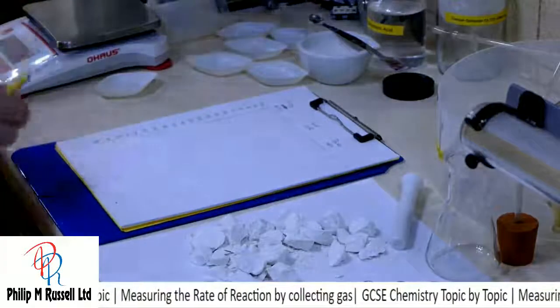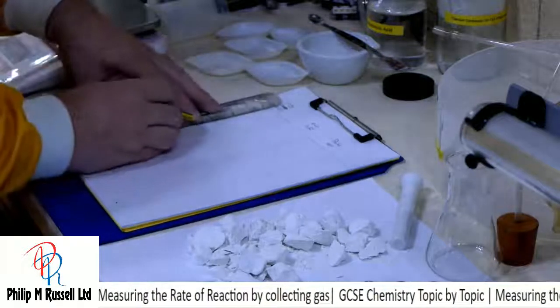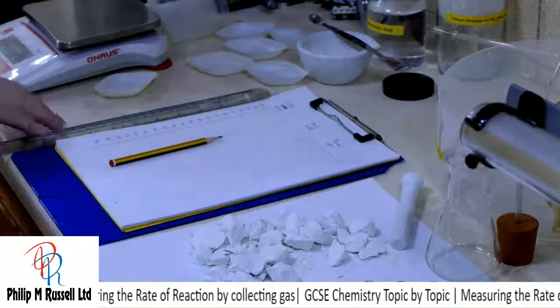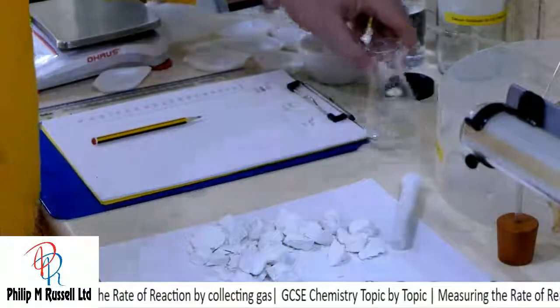Okay, so it appears that I'm now more or less ready to do my experiment. The only thing I now need is some acid in there, and the amount of acid I'm going to have is in fact going to be in excess.